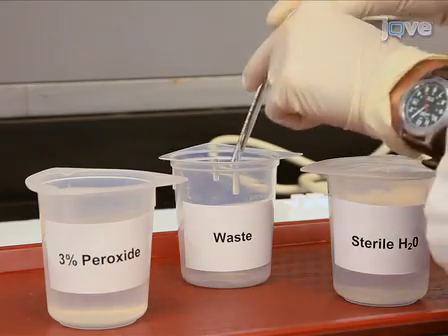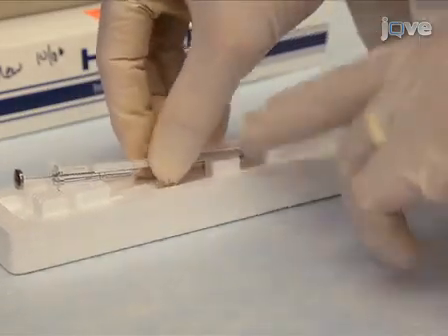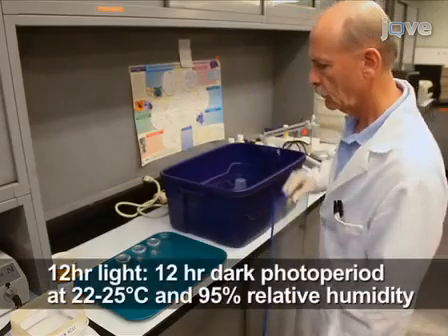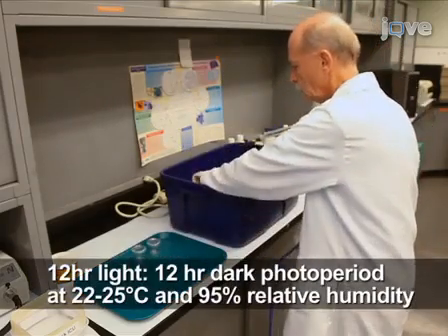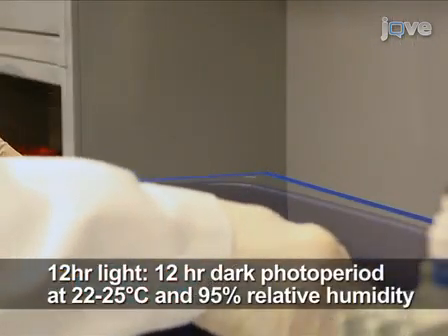Take care not to bend the plunger of the Hamilton syringe, otherwise the plunger will not move smoothly and respond to the gentle touch required for tick injection. After the injecting, place the ticks in a chamber with a container filled with water and potassium sulfate, which maintains high humidity, and hold them for 1 day.